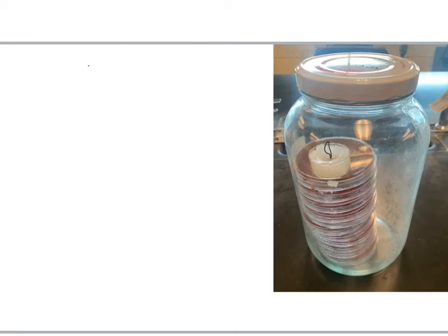Okay, so once the amount of oxygen decreases in the jar, okay, the light will go out. Okay, you know that flames need oxygen to burn. So yes, there is less oxygen in that candle jar, but what we are most interested in, though, is that CO2 is a product of combustion.